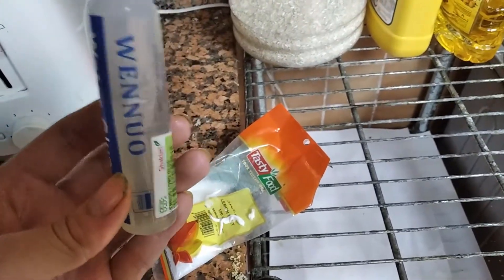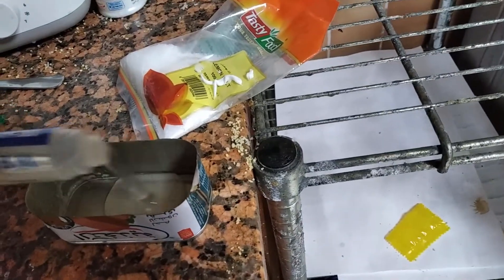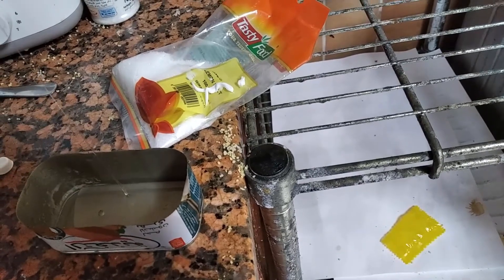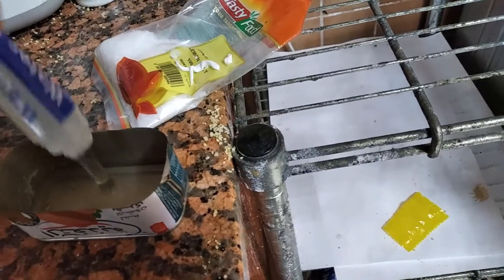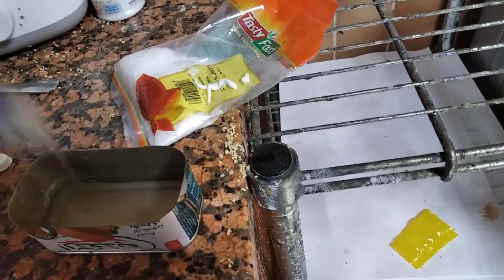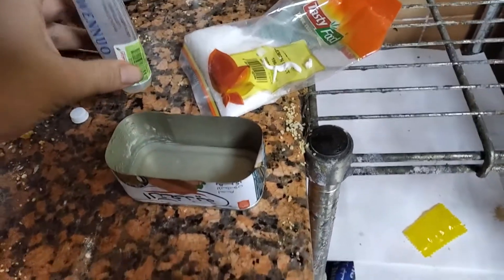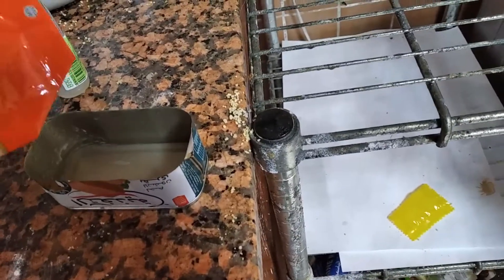I'm using this clear glue. I just pour in however much I want. Since I'm making a larger membrane, I'll pour around this much. This glue is basically a pure PVA solution in water, so there's almost nothing in it except what we really want. We pour just an arbitrary amount of citric acid.